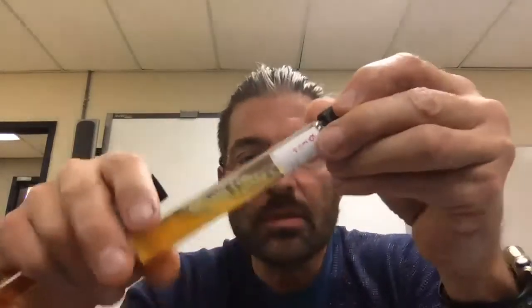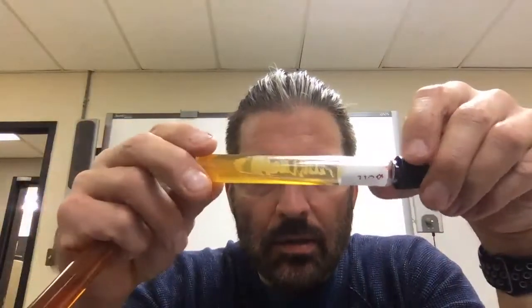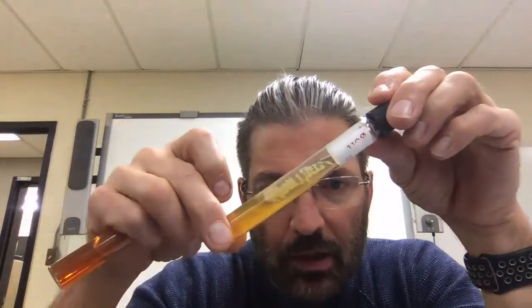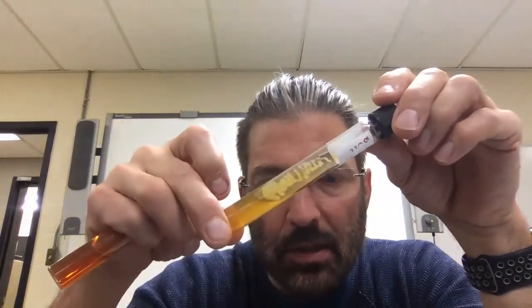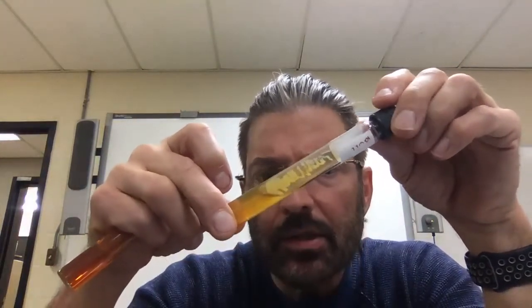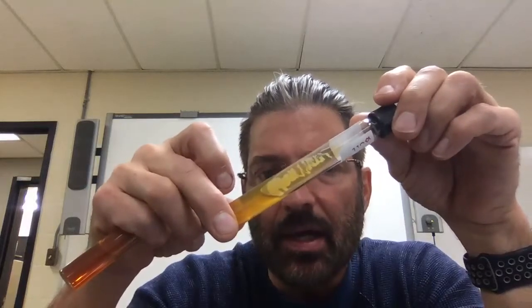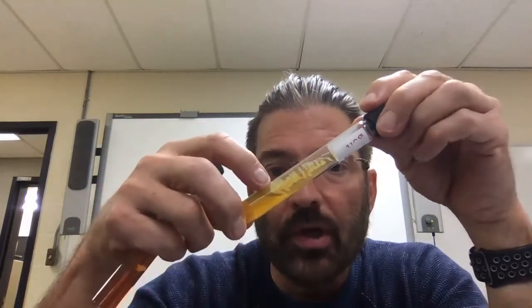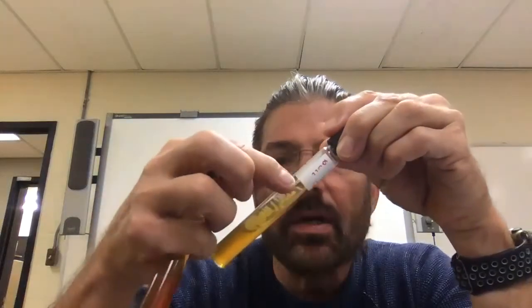So here is Serratia. Orange turned yellow, very, very acidic. And if you look, Dr. Bailey did this one, you can literally trace her zigzag pattern. She used the inoculation loop with aseptic technique, and you see at the base here she had the majority of it, and then she zigzagged out, and it got thinner and thinner.